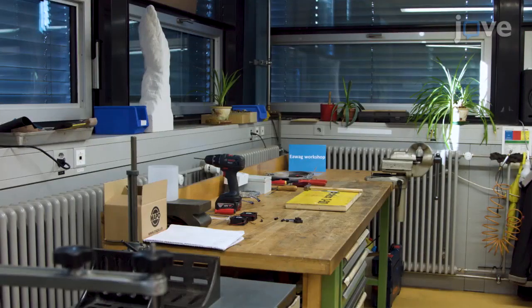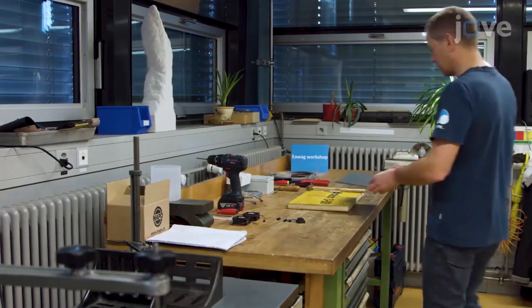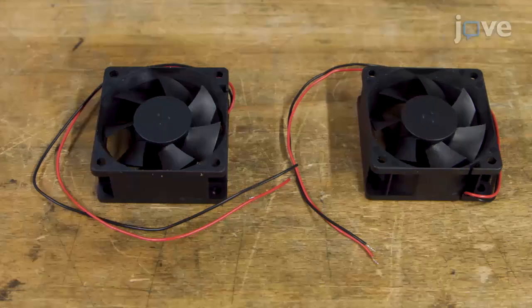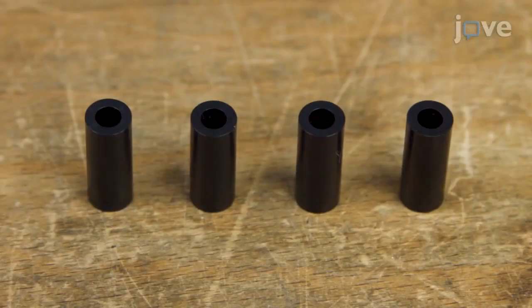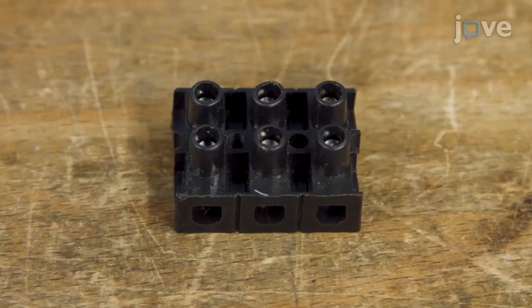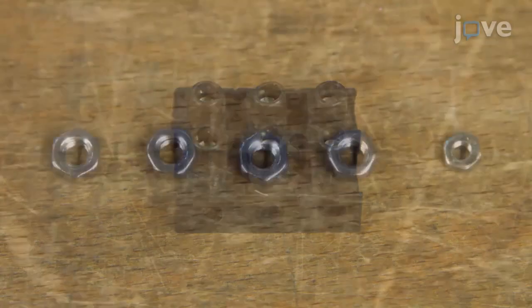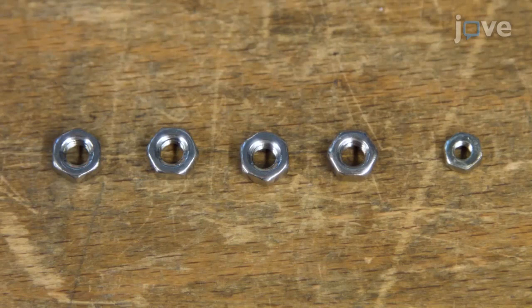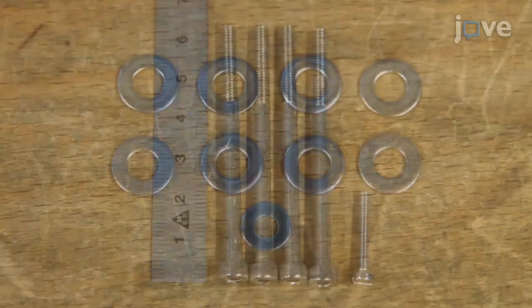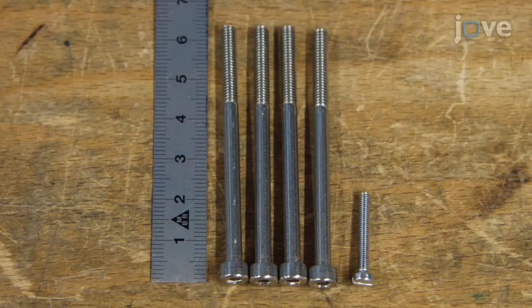Before assembling the heating unit, gather one 280 by 250 mm support plate, two 60 by 60 by 25 mm axial fans, four 20 mm long spacers with an internal diameter of 4.25 mm, one luster terminal with 3 pins, 4 M4 and 1 M3 screw nut, 8 M4 and 1 M3 washer, and 4 M4 and 1 M3 screw.